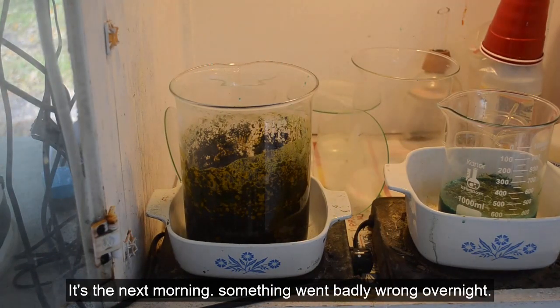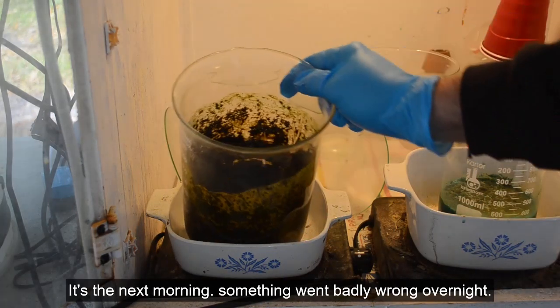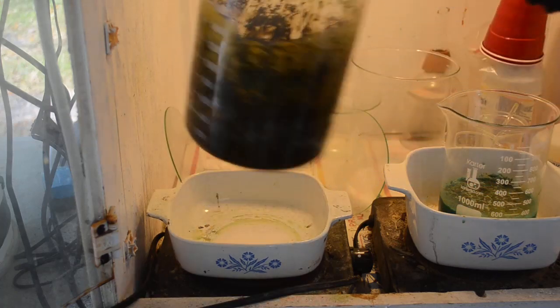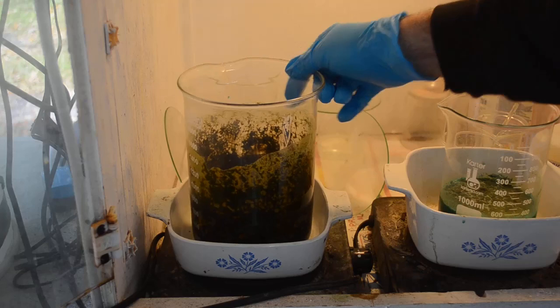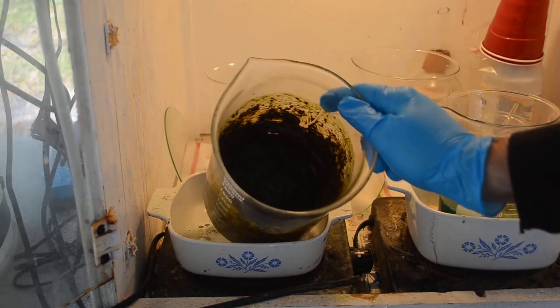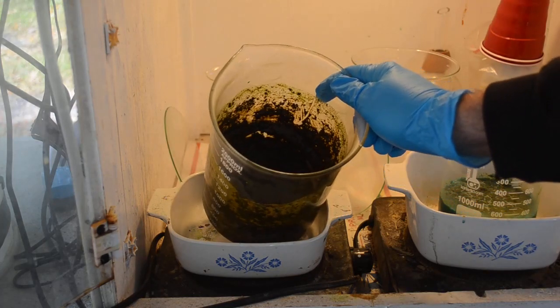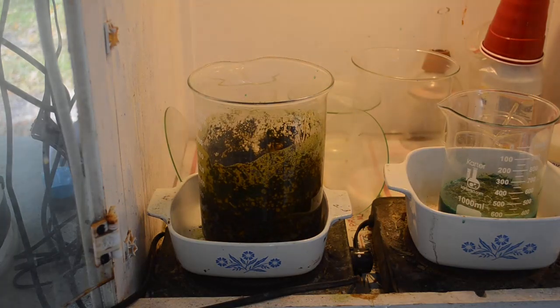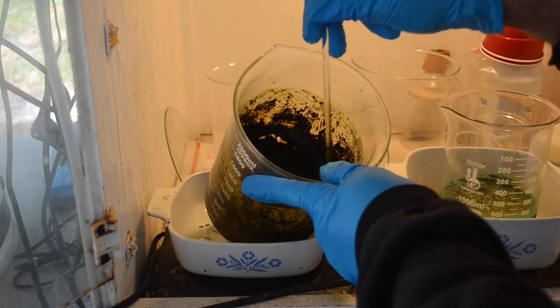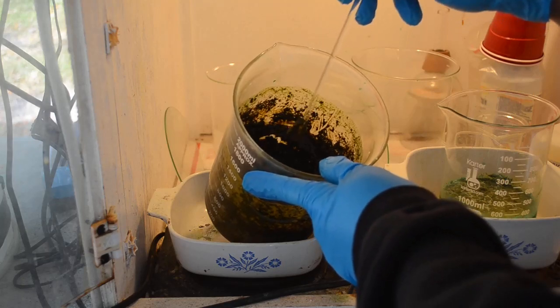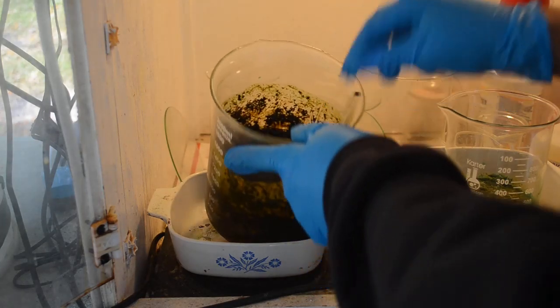Well, that didn't work. Ha! Must have been some sort of thermal runaway overnight. My goodness. Look at that. And, I mean, this was only warm. I only had the hot plate on very low, warm. But yet, something ran away once most of the water evaporated from it. I guess I'm lucky it didn't catch fire or explode. Ooh, that's like tar in there. How the heck am I going to clean that up? Sometimes you just want to throw your glassware away and start over.